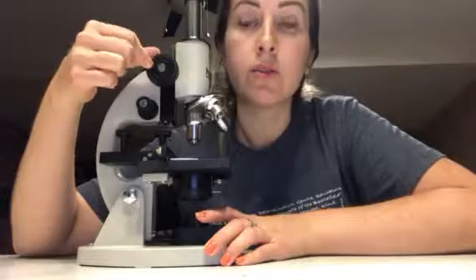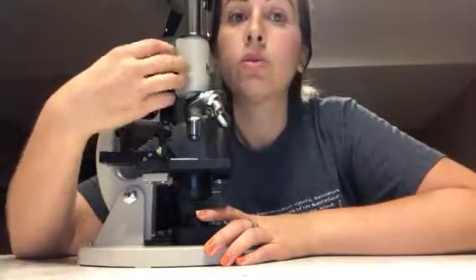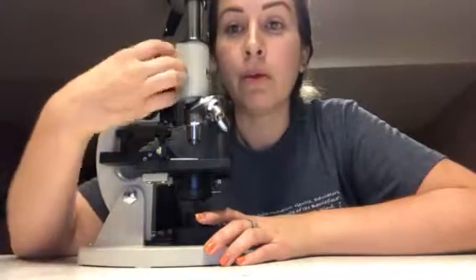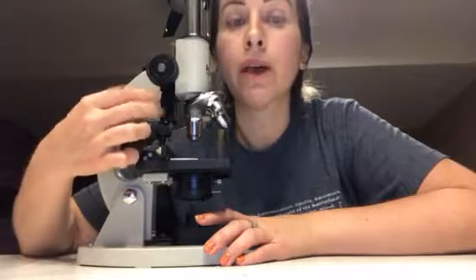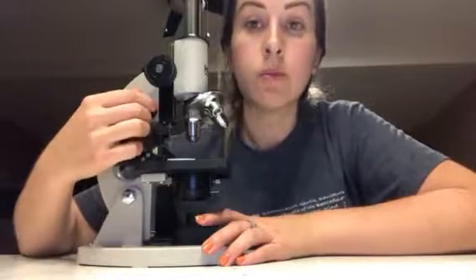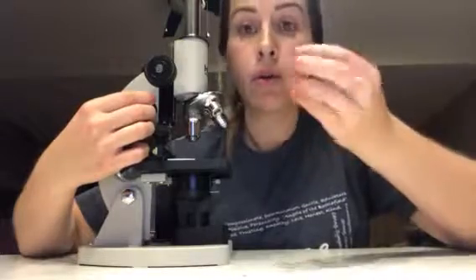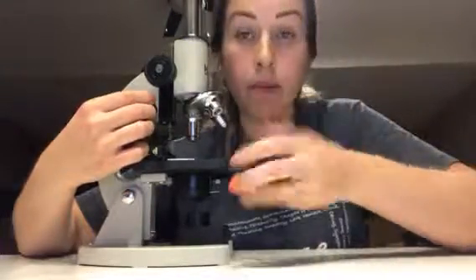Then we have the knob that I mentioned earlier. This one is the coarse focus knob. This is when we want to do a larger amount of focus, so it does move a significant amount up and down. Then we have the fine focus knob, which is right here. This one helps focus when we're magnifying at a higher power, but it only changes the focus in small increments. It makes things look sharper, or also less sharp, like fuzzier.